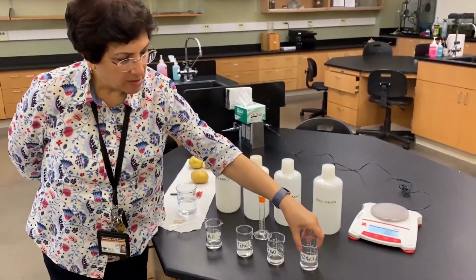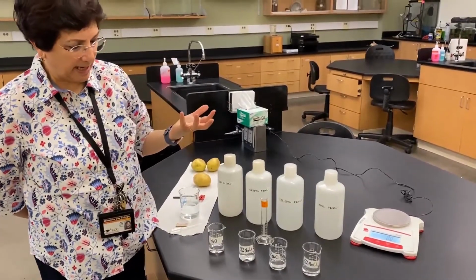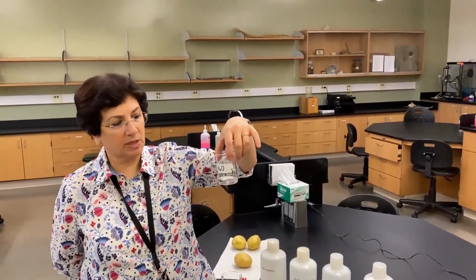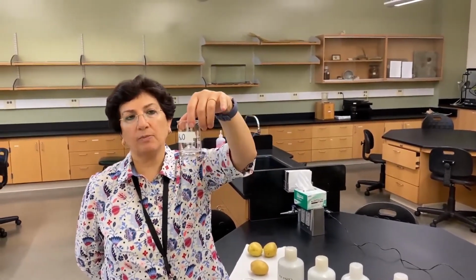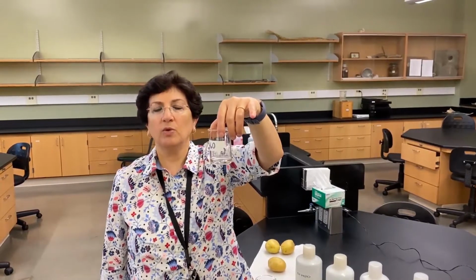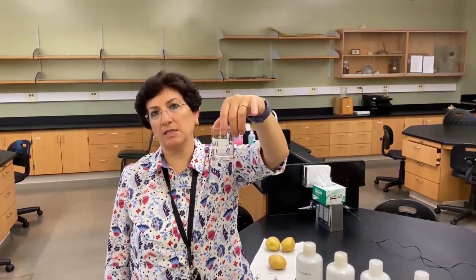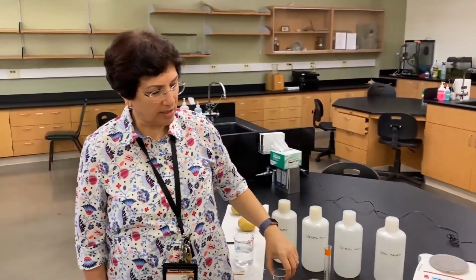Okay. So if we soak our potatoes and come back and weigh them again, what do you think is going to happen? These are our hypotheses. We're going to write one for each of these treatments. So if I put the potato in water and 45 minutes later, do you think the weight of the potato piece is going to go up, down, or stay the same? When cells are placed in a hypotonic environment, what do we expect?